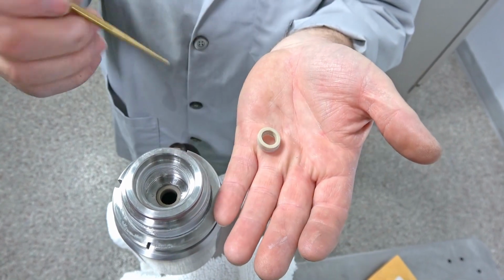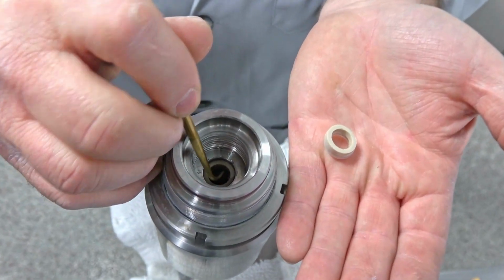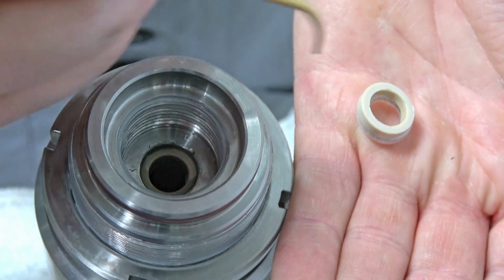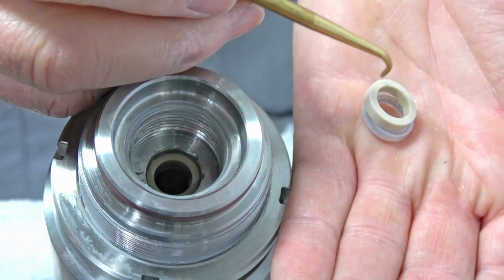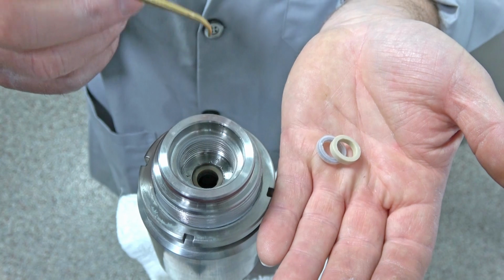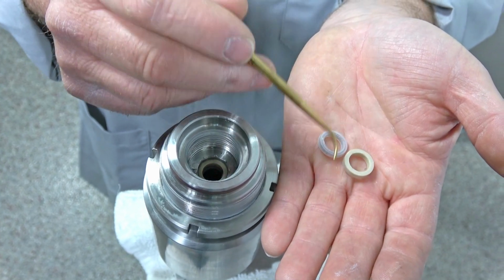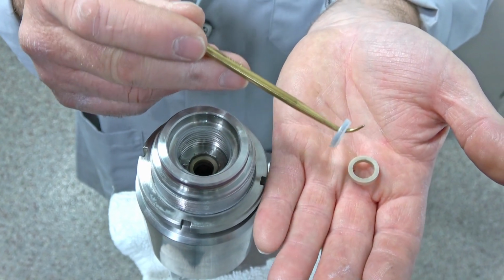Now, because I've already reached in here yesterday and pulled these out with my brass pick, when you pull them out, this top one here, if it doesn't come out very easy and you get little nicks in it, then I replace it. But if it just comes out really easy, I'll reuse that one. But this is the one right there.